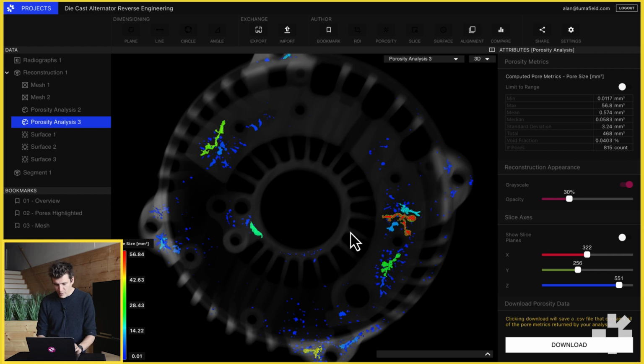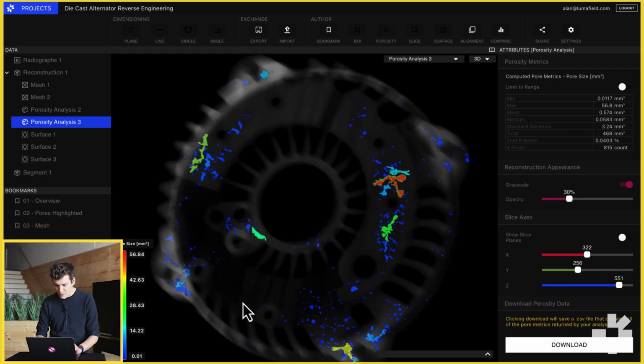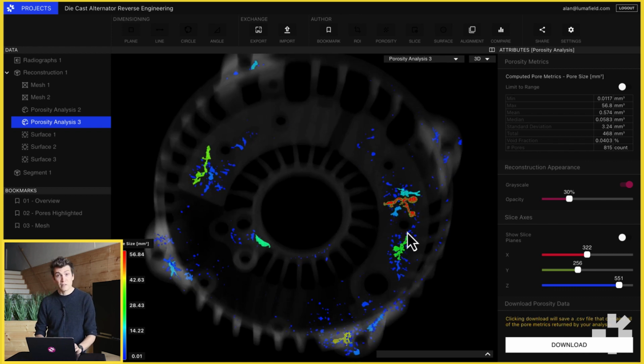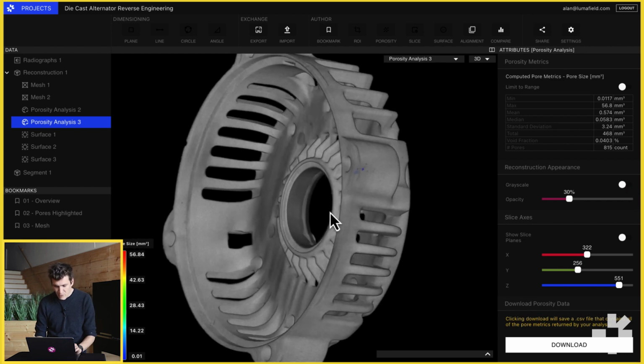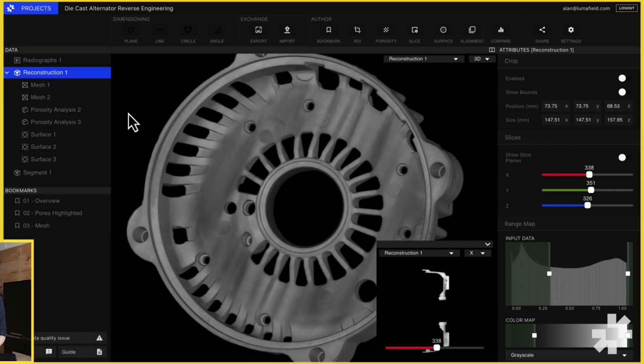In order to get the most out of porosity analysis, it's helpful to visualize the data in both 2D and 3D. Let's go over some tips and tricks to do that. When you enter porosity analysis in Voyager, by default, Voyager ghosts out the part so that we can easily see those pores in 3D. For many visualizations, it's actually very helpful to undo that and look at the pores in the solid part. If we scroll down to Reconstruction Appearance and uncheck Grayscale, the visualization will now inherit the rendering settings from the parent reconstruction.